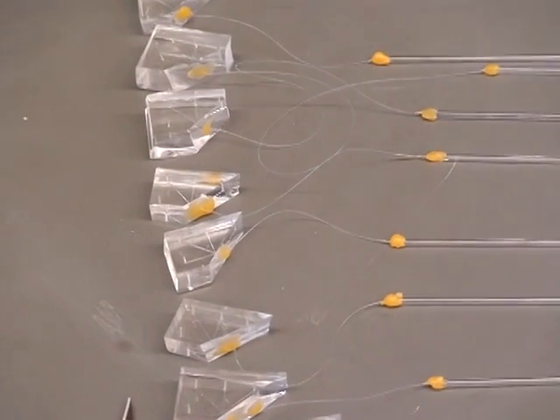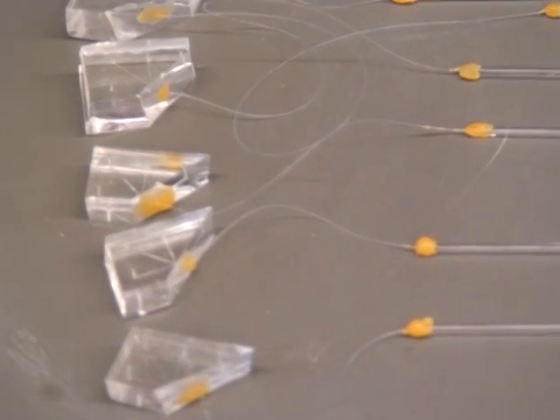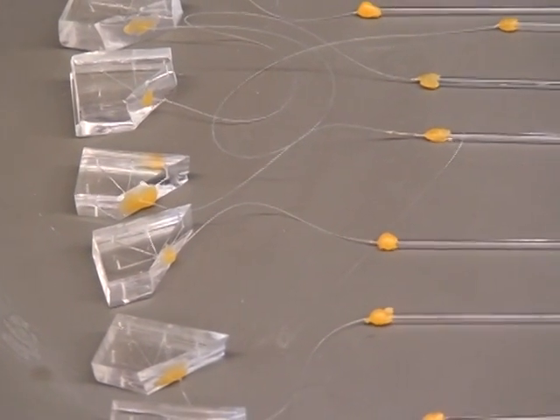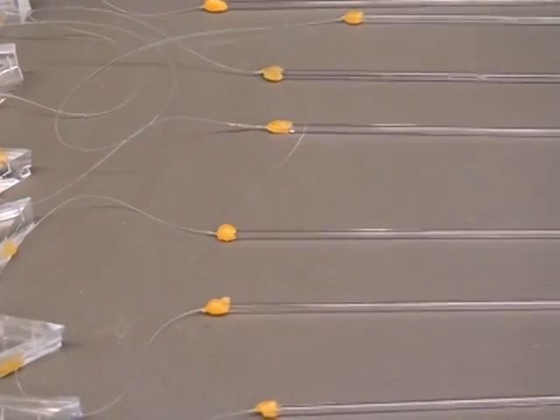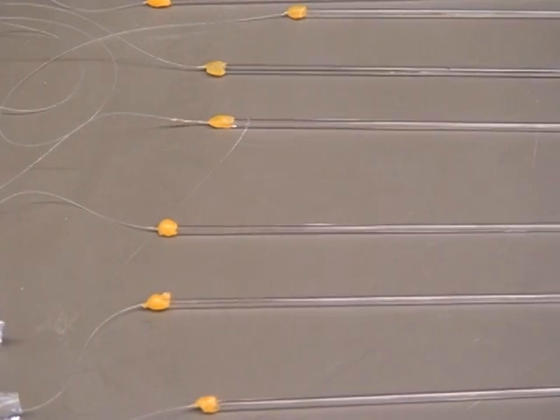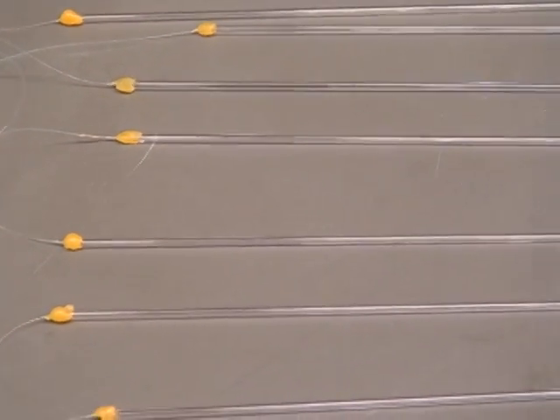You can see that the devices are connected to the small Teflon tubing using wax. That Teflon tubing is threaded through a glass capillary that's filled with FC-70, and this prevents evaporation.